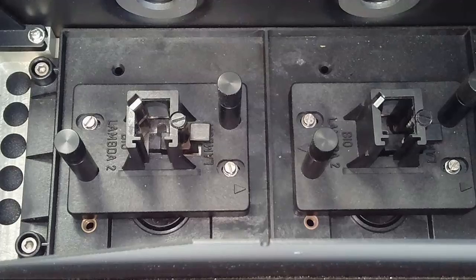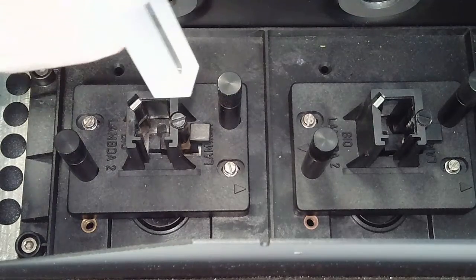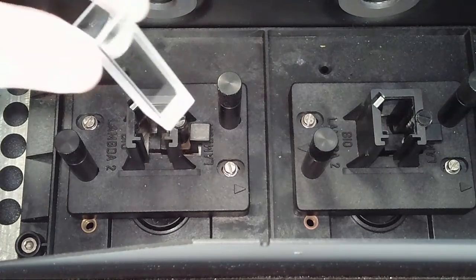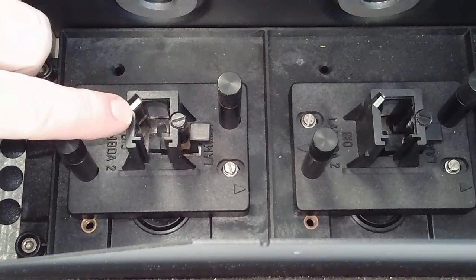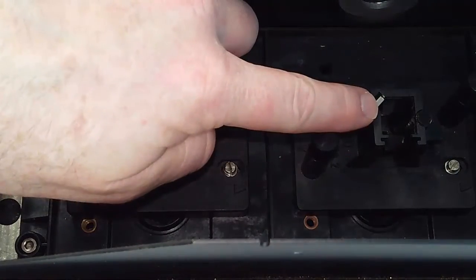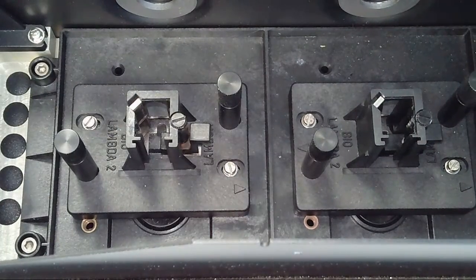All right, we're back and we're about to load a sample into the instrument. So I have a glass cuvette, clear sides, cloudy sides, clear side, cloudy side. See, and it's got distilled water in it. So that's my solvent for this one. We've got the camera set up so that this sample holder is in the front of the machine, and this sample holder is in the back of the machine. We want to always use the front one.